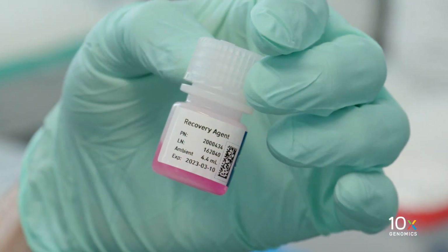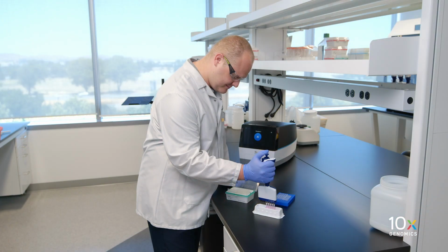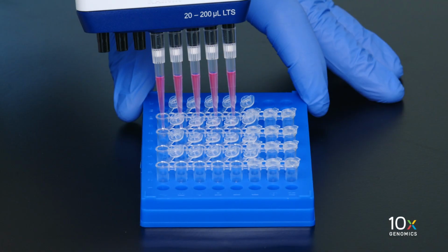We completed GEM transfer and GEM-RT incubation. Now we are ready to break the GEMs. We have the recovery agent at ambient temperature. Add 125 microliters of recovery agent to each sample in the tube strips at room temperature.